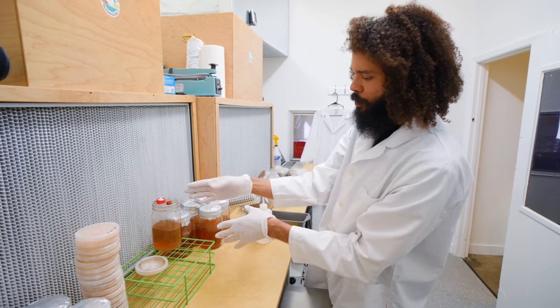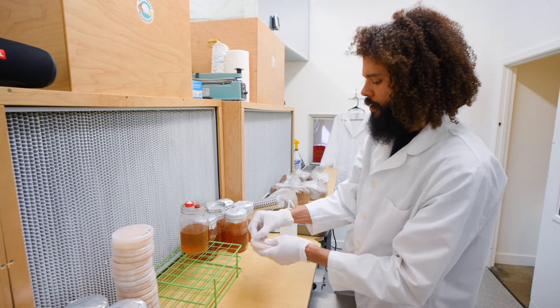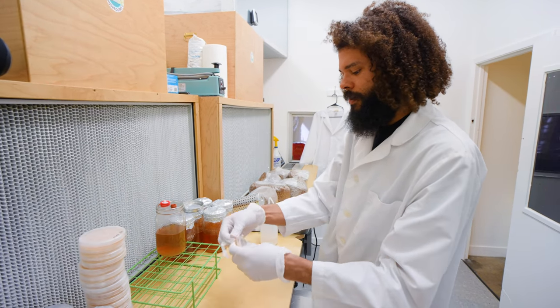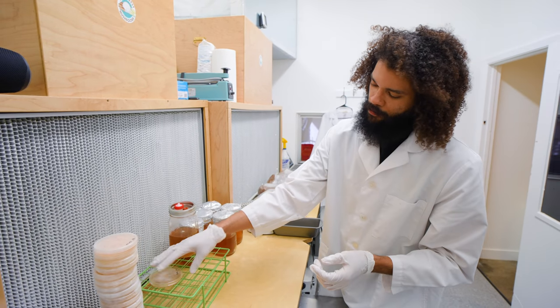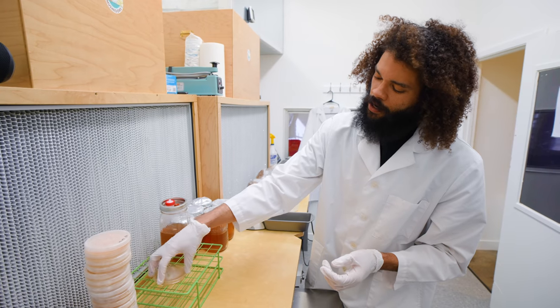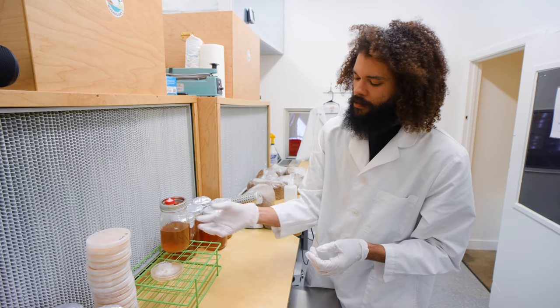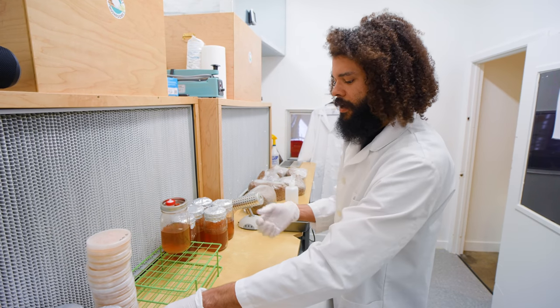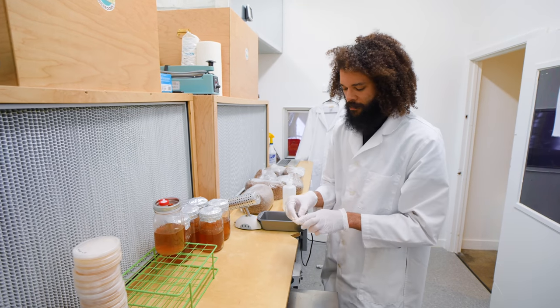I'm prepping myself up, removing the ring at least before I start using my scalpel — that way I don't make a mistake or drop anything. When I remove the lid of the plate or put it back on, I really try to keep my fingers right around the top edge to minimize the chance of getting any contamination on the agar as I move it on and off.